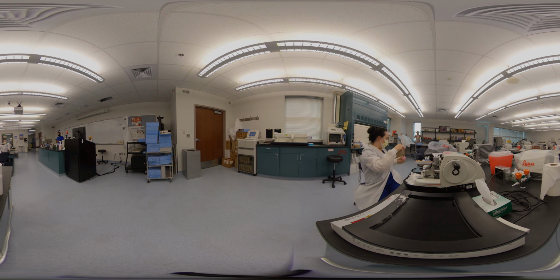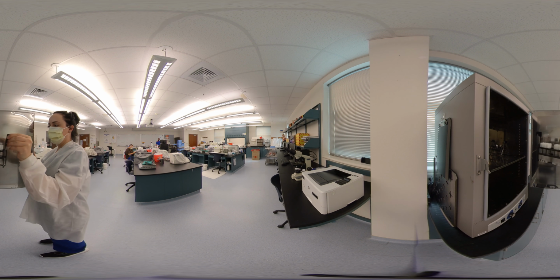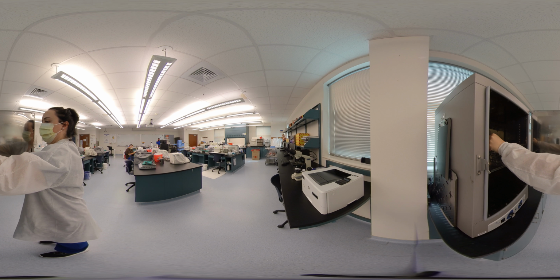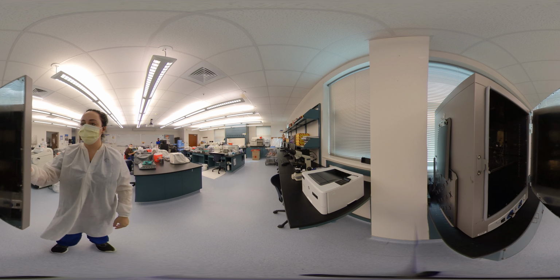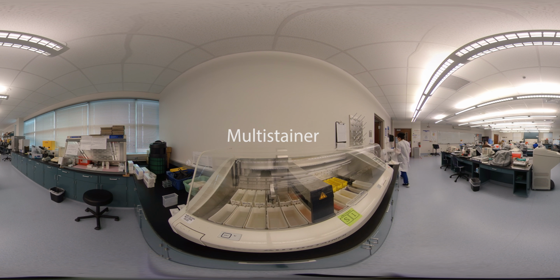Before we can stain tissue that is on slides, we need to heat fix the tissue to the slide. We do this by placing them in an oven. Once they're removed from the oven, they go to the multi-stainer. Look for the word multi-stainer to identify its location. As I stated in our previous lesson, staining can be done by hand, but automation is always preferred as results are more consistent from patient to patient.